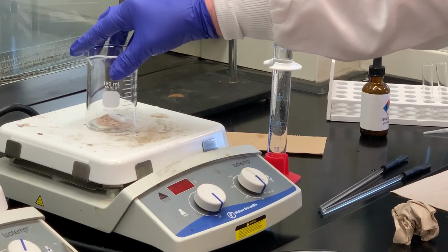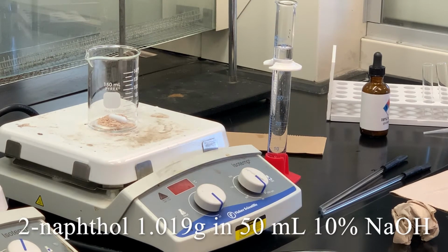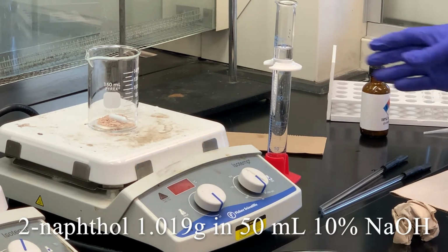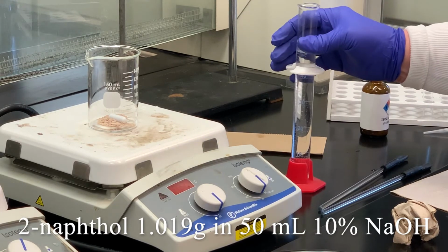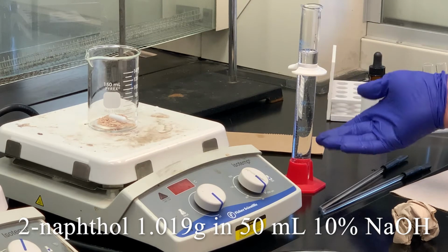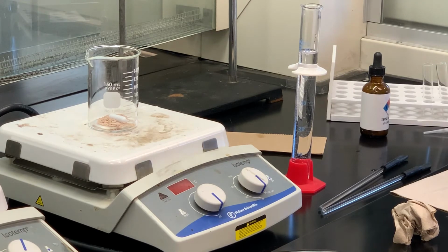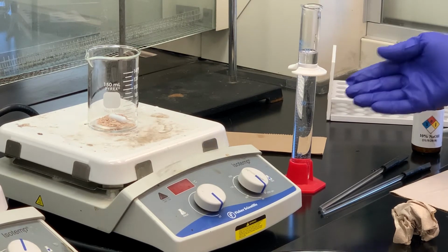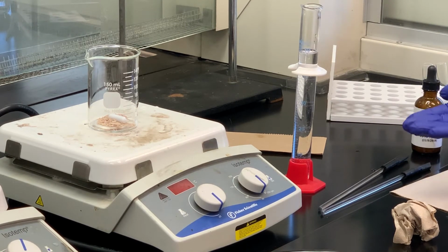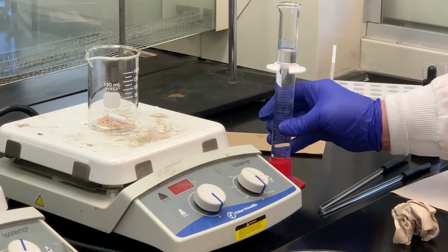I've weighed out our coupling component, which is the 2-naphthol, and I've got 1.019 grams of that into a beaker. To that I'm going to add 50 milliliters of a 10% sodium hydroxide solution. You may notice that there's some particulate matter floating around in there. Sometimes when solutions sit over a period of time, the solute crystallizes out, so we probably have some undissolved sodium hydroxide. I'm not going to worry about filtering that. We'll just go ahead and use it as it is.